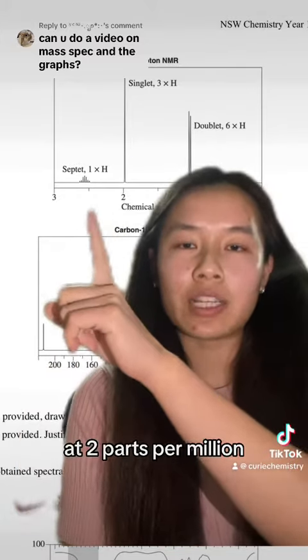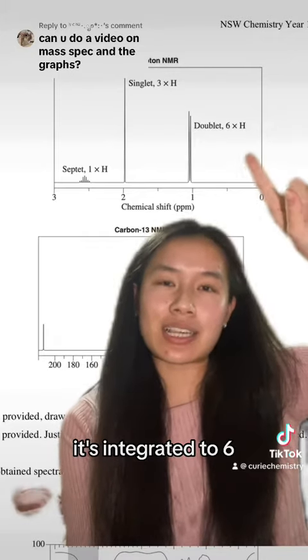This peak at 1 parts per million is so upfield compared to the rest, which means it's furthest away from that electronegative oxygen. It's integrated to 6 and it's a doublet.